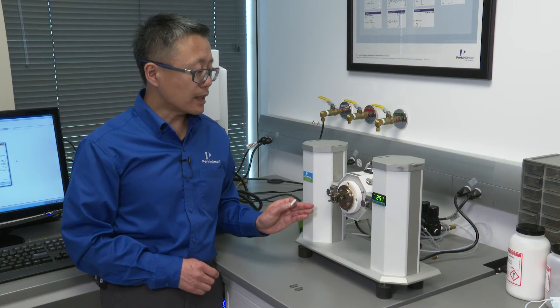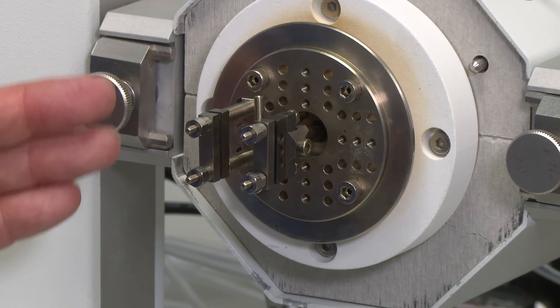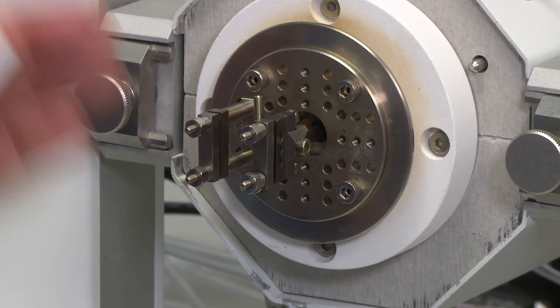For single cantilever bending setup, it's very similar to dual cantilever bending. Instead of having two fixed pillars, we're only using one of them.